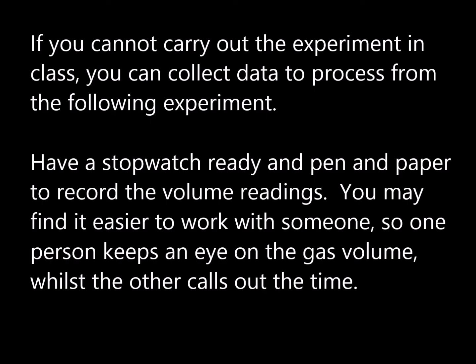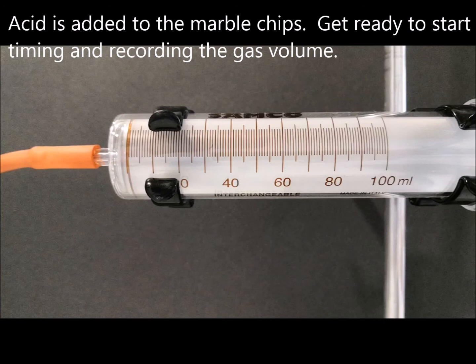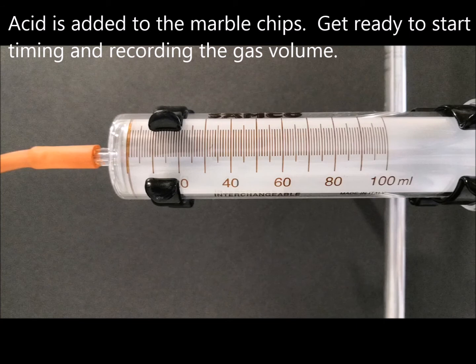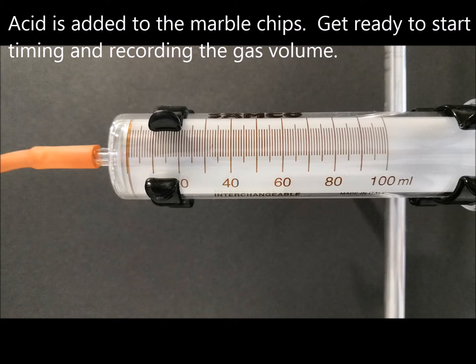If you cannot carry out the experiment in class, you can collect data to process from the following experiment. Have a stopwatch ready, and pen and paper to record the volume readings. You may find it easier to work with someone, so one person keeps an eye on the gas volume whilst the other calls out the time. As the acid is added to the marble chips, get ready to start timing and recording the gas volume.